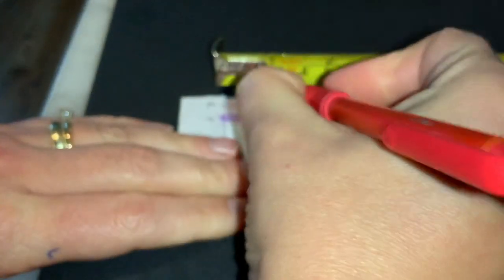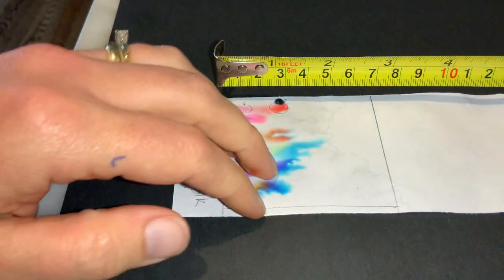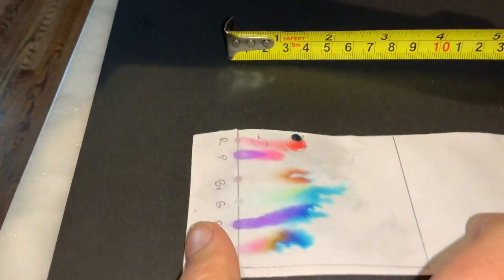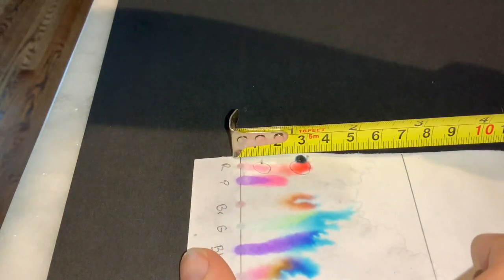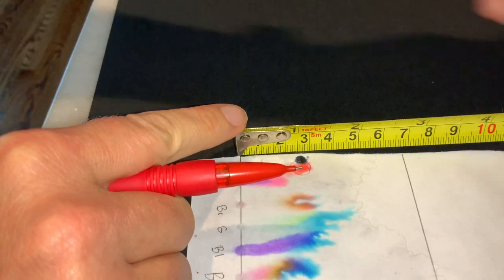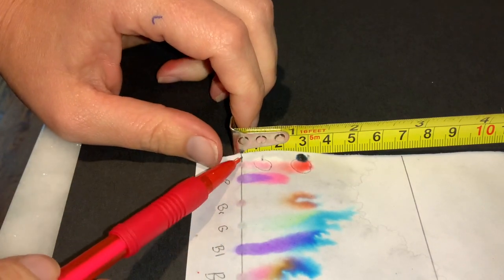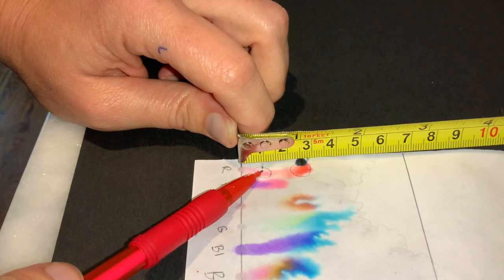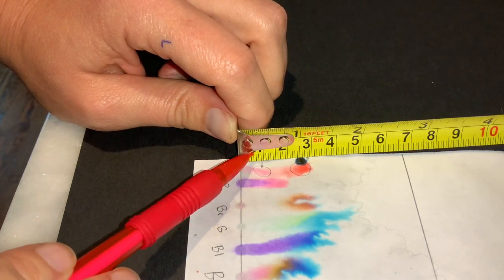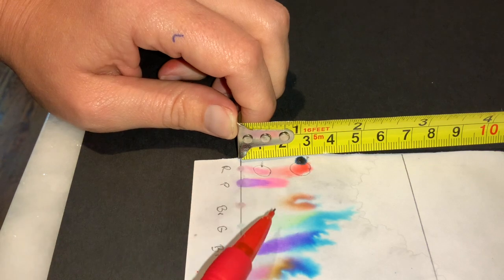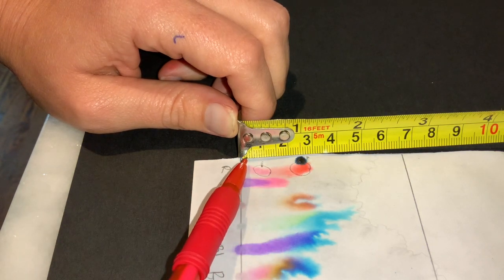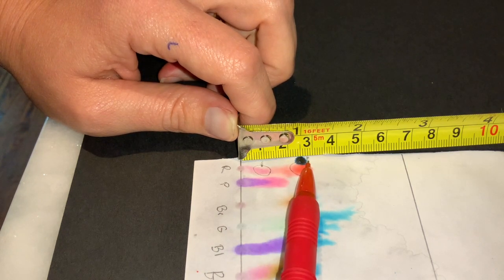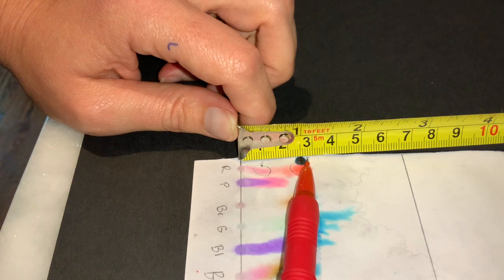So let's go back, we're going to measure to this line here. So we're measuring again from here to that line, and so what you're going to see hidden here, so this would be one, and then you're going to measure to this line. So go ahead and take your measurements with your appropriate number of significant figures.